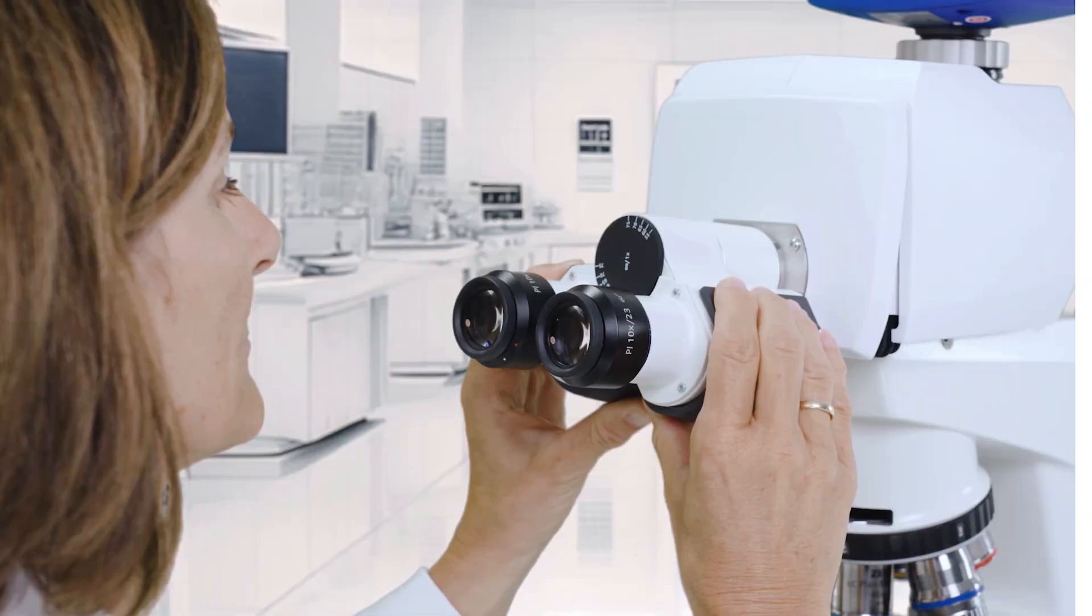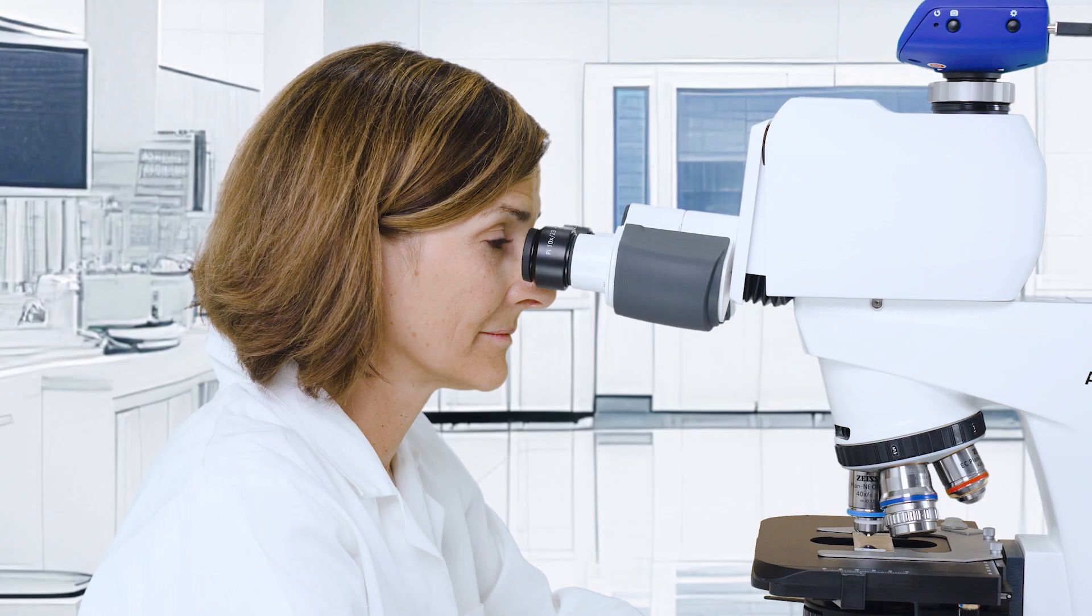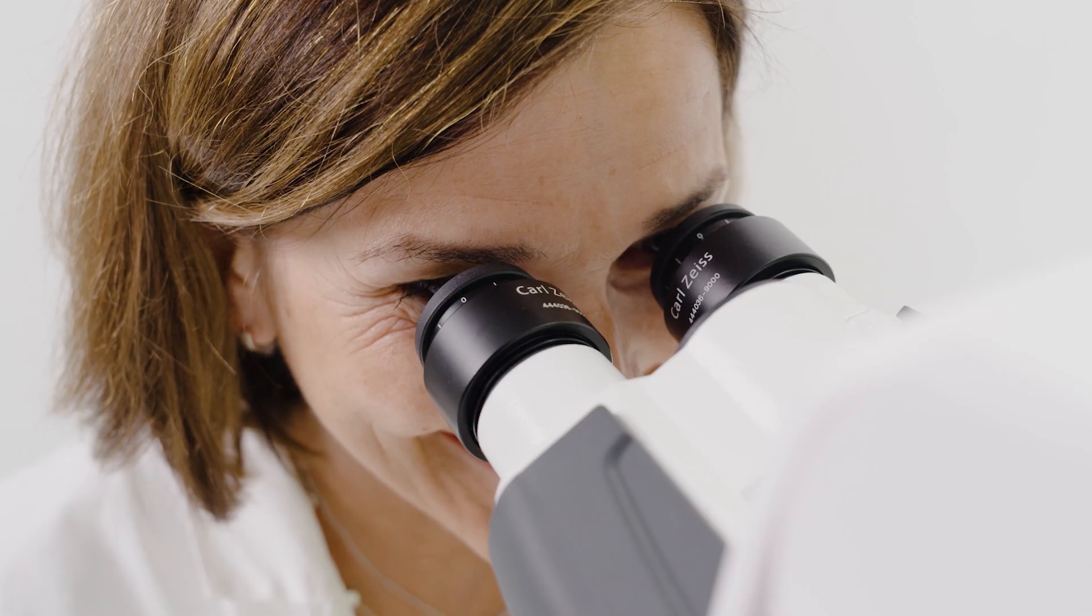Ensure that the eyepieces are at the right distance for clear and relaxed viewing. This helps to prevent eye fatigue during long microscopy sessions.